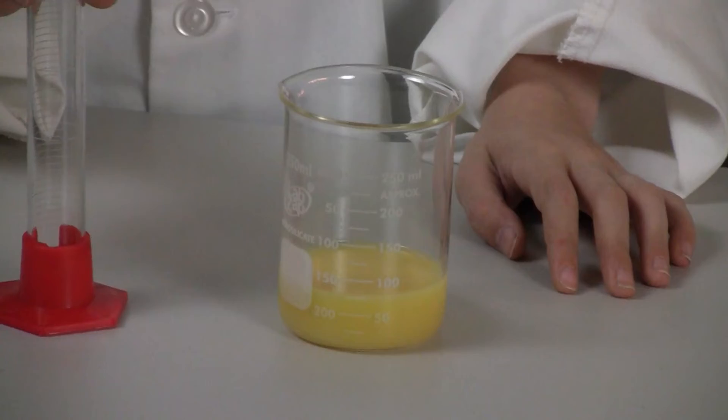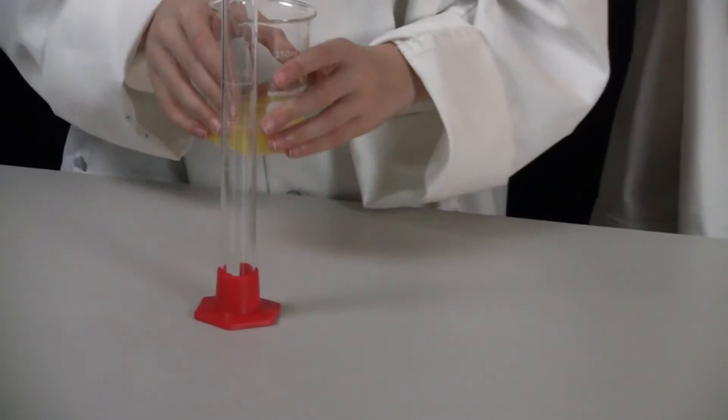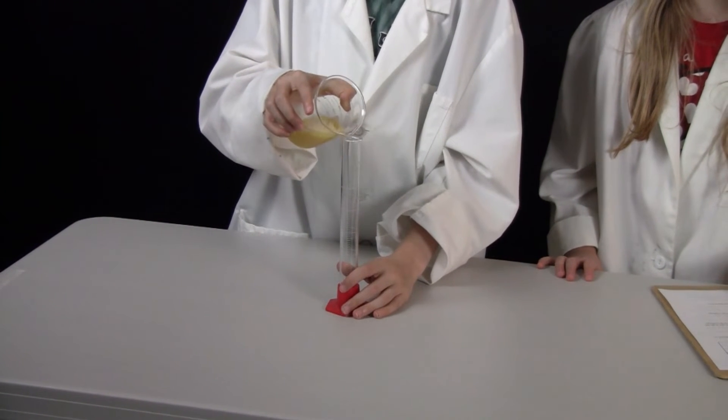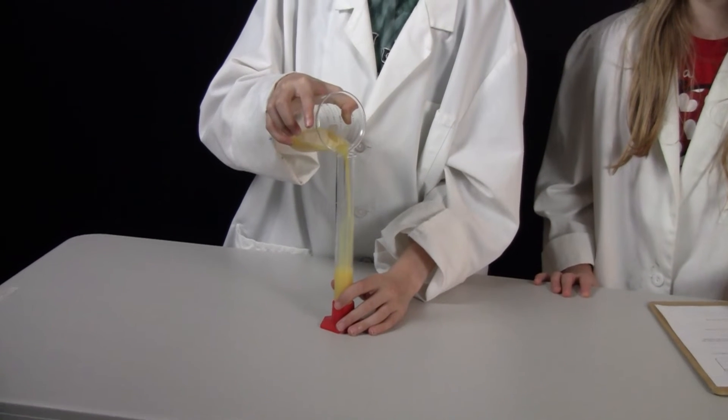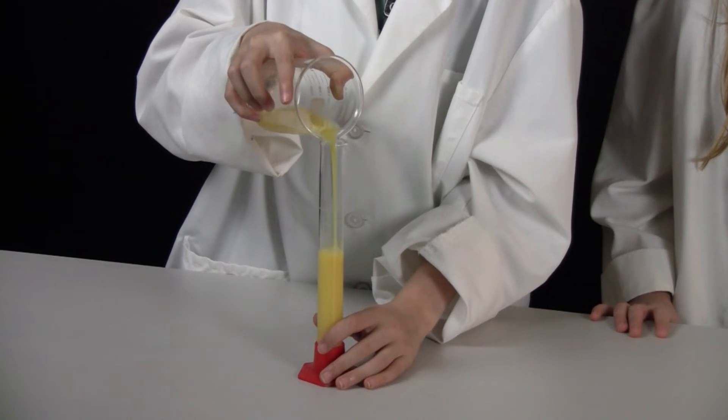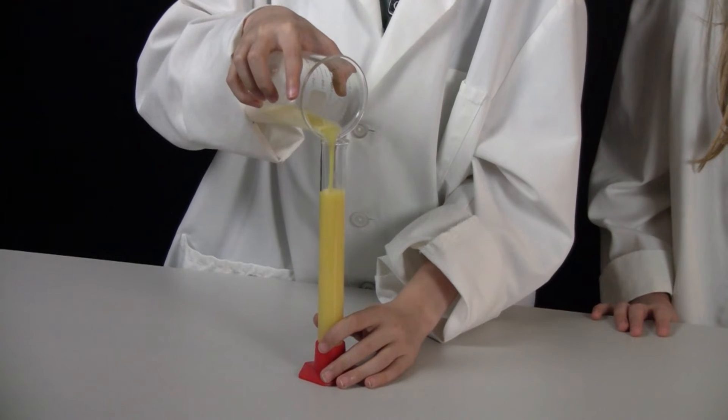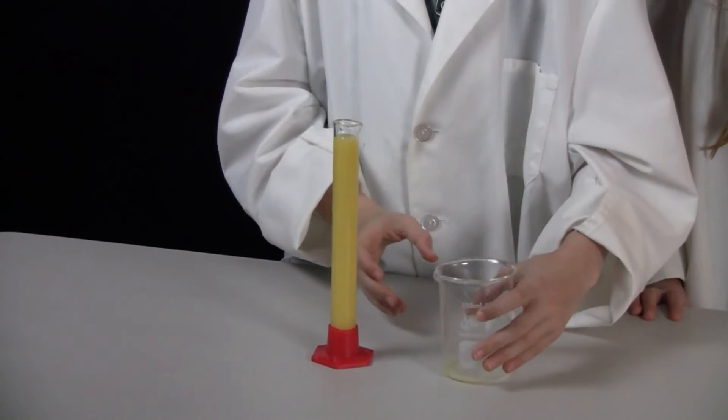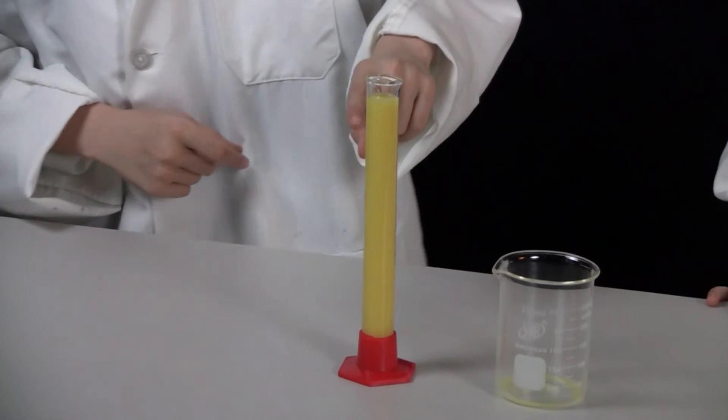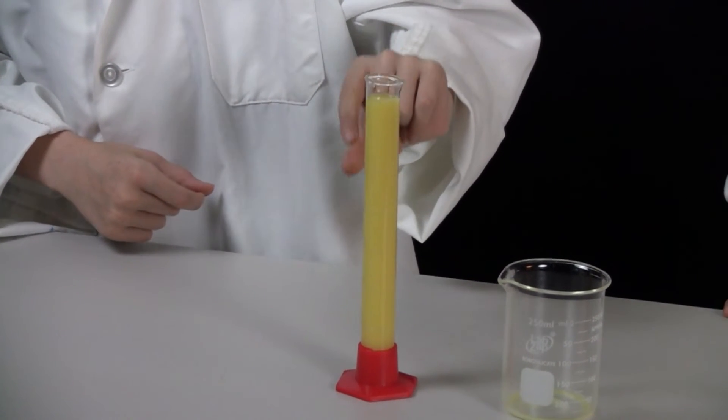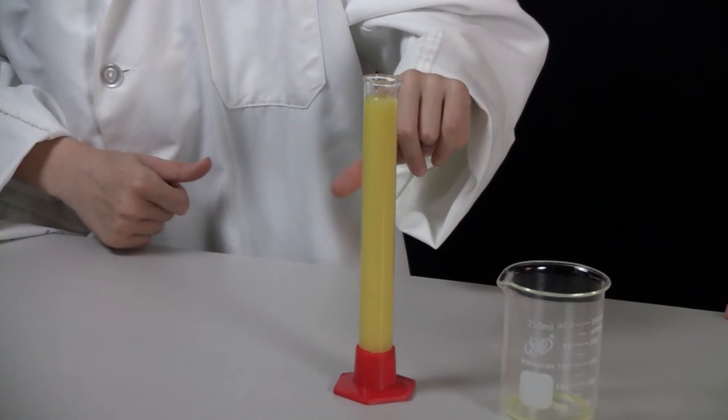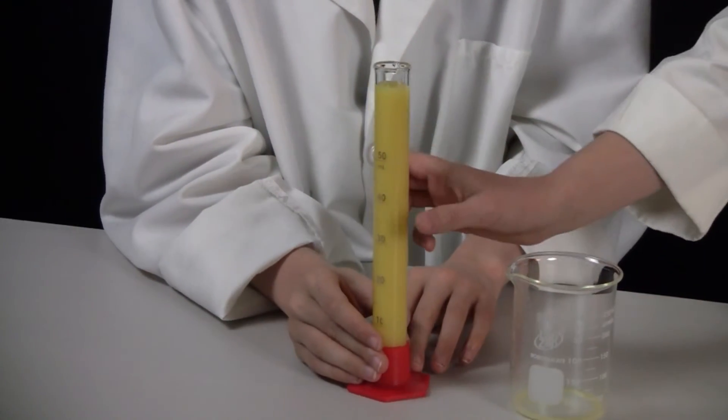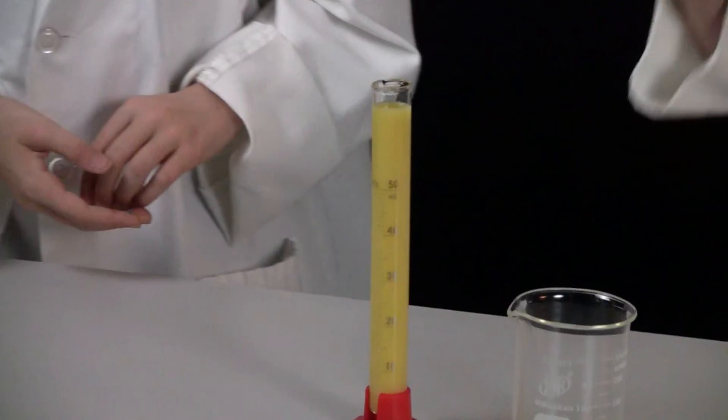So that's 75. We don't even need to interpolate or estimate that. Now we are pouring from that beaker into a graduated cylinder. And if you are doing this at home and you don't have these, you can just use a glass measuring device. So now you are going to have to interpolate that because I don't think on that graduated cylinder it goes up that high. Can you turn it around so we can see, the camera can see the numbers? So let's look at the top of there.